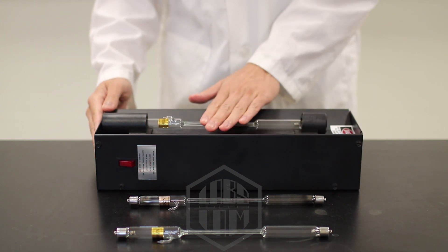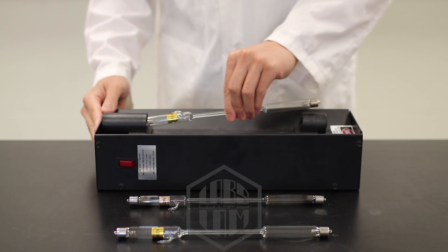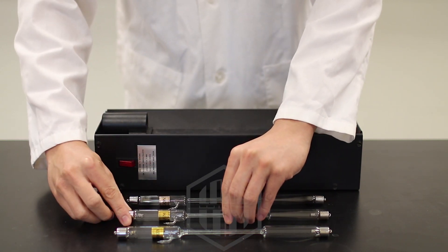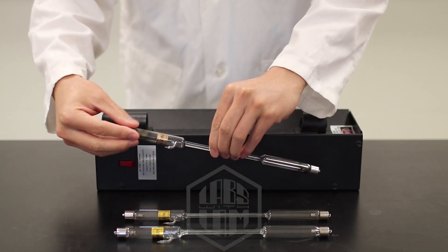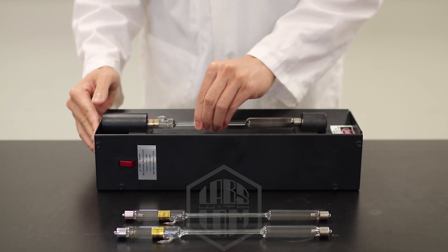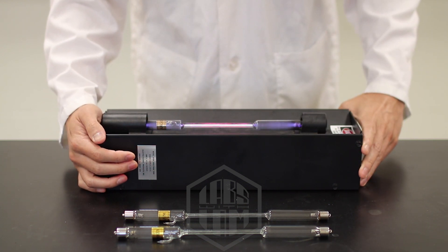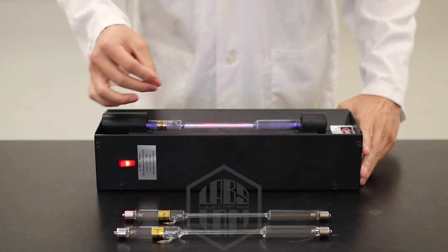Again, just being extra careful taking these out, making sure they're not too hot. And we'll do this one more time with argon. Here we go. Just focus your viewers right in the middle here.